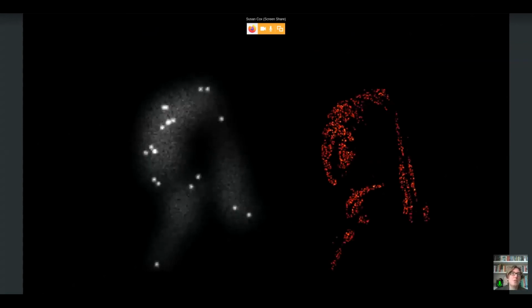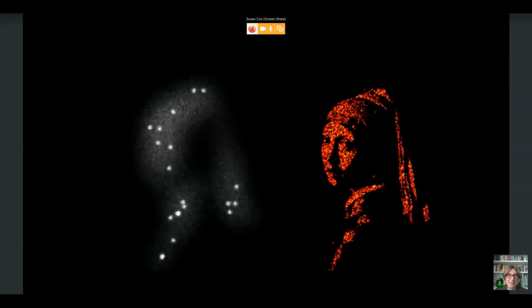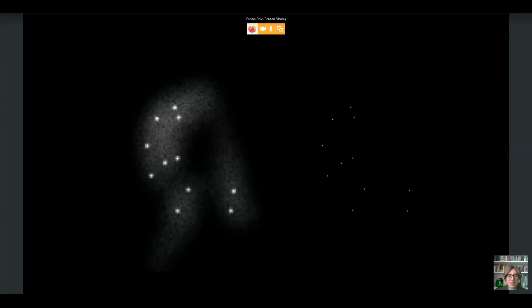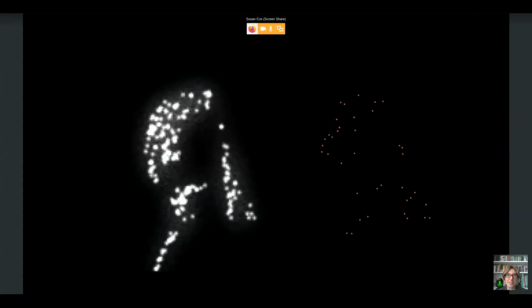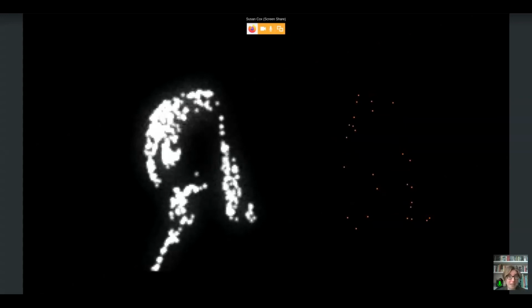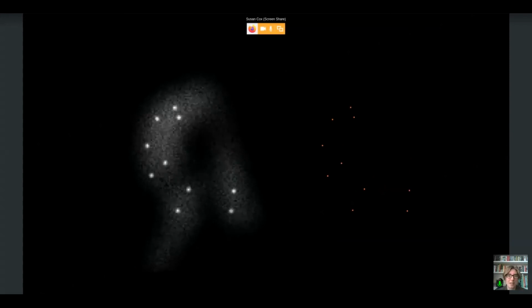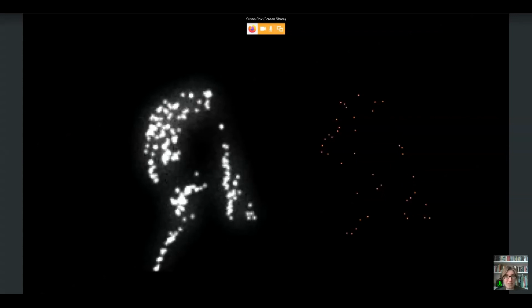So if this is what our original localization microscopy looked like, what happens if we think about changing the activation density, that is, the number of fluorophores that are activated in each frame? We start out here with very few fluorophores being excited. And you can see as I increase the activation density for a while, I get more fluorophores being localized on the right. I'm filtering them out after a while so that we can just see how many are being localized for a given activation density. It increases for a while, but then as I increase the activation density further, it decreases again because fluorophores are overlapping and I'm not able to image them successfully.